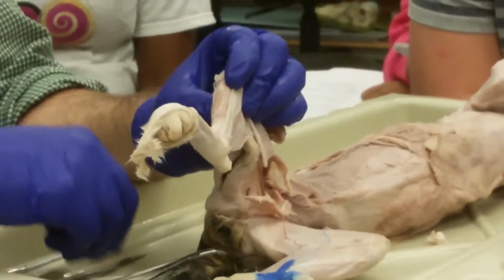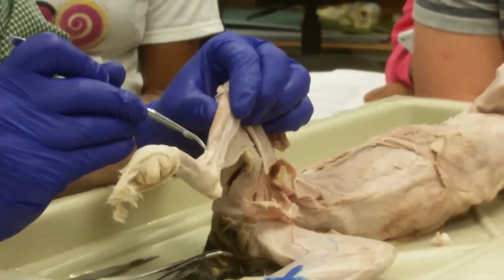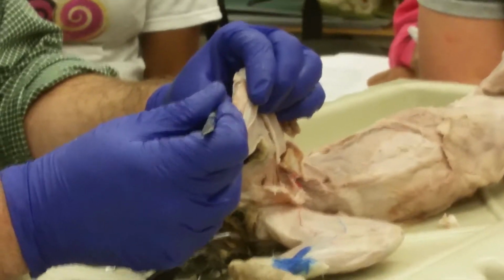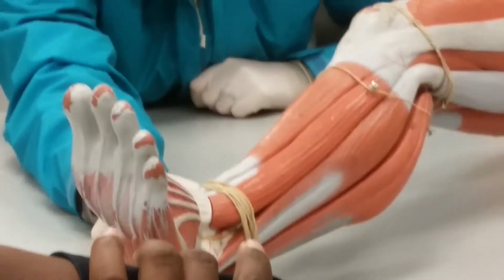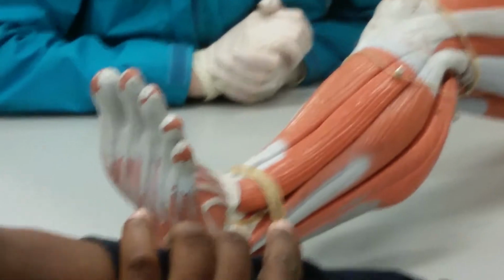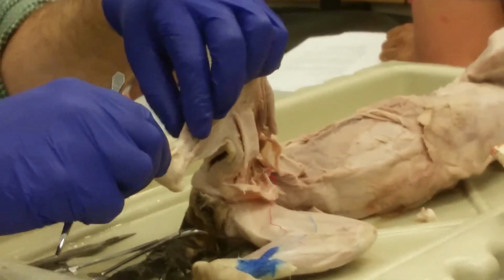Okay, so there's your tibialis anterior. It comes from the tibia. You look here, we can follow its tendon. The tendon goes underneath, right next to the tibial crest. The tendon goes underneath a band of tissue, and you can see those little white bands around the ankle. Those are called retinacula. There are actually two of them, and they direct the tendon into the foot. We see it inserts here on the medial side of the foot, on the top and medial. So it goes from tibia to the top of the foot.